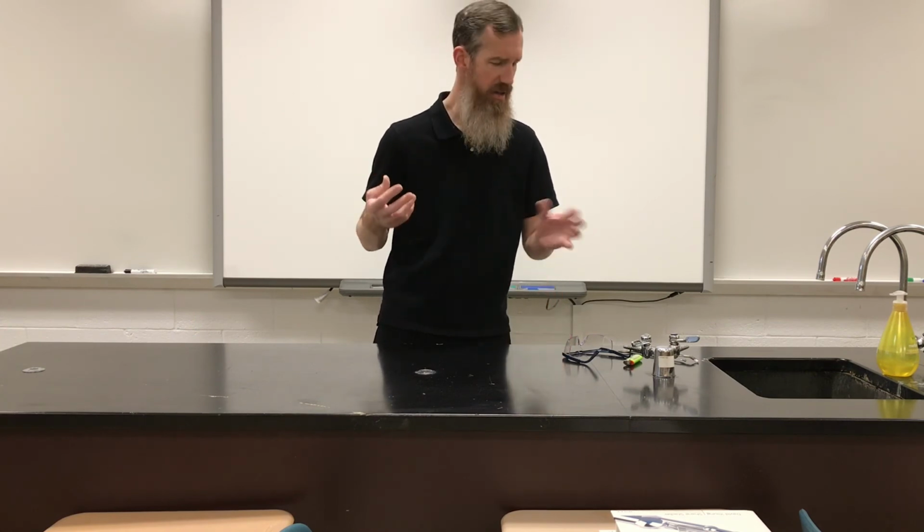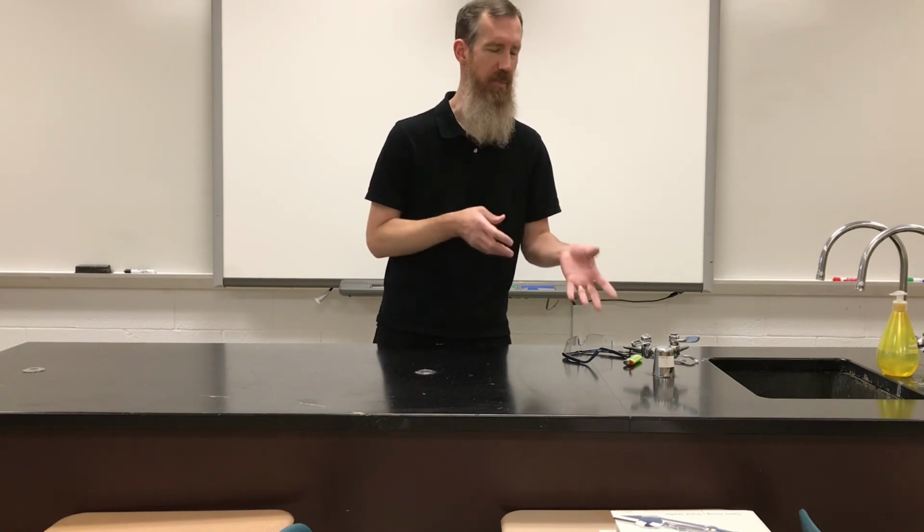We're going to clearly indicate when the reaction is happening, what changes were occurring here. Obviously, a bright, hot, orange, blue flame. Well, really, the color would have been the blue flame. The orange happens a little afterwards. And there's more that we're going to have to add to these sheets and our discussion regarding chemical reactions as we move forward in the unit.